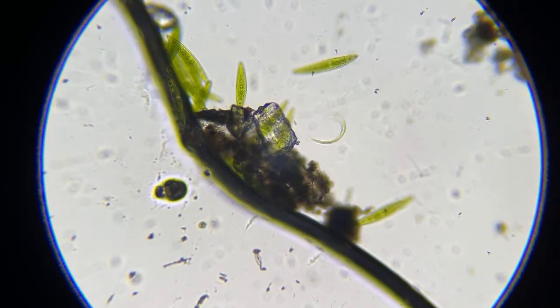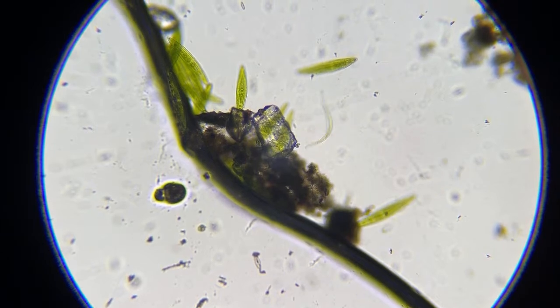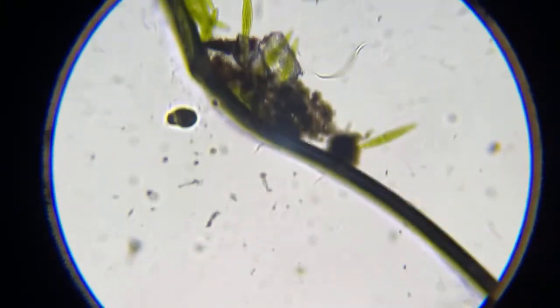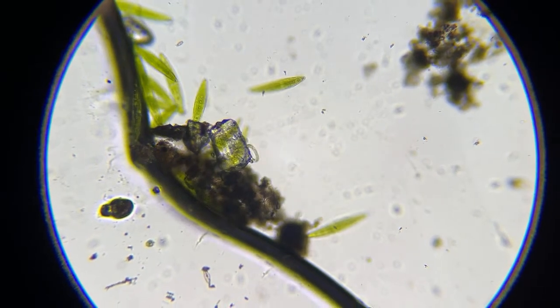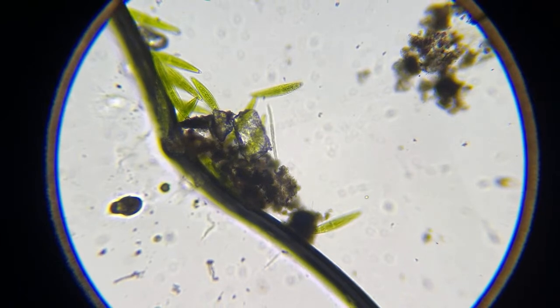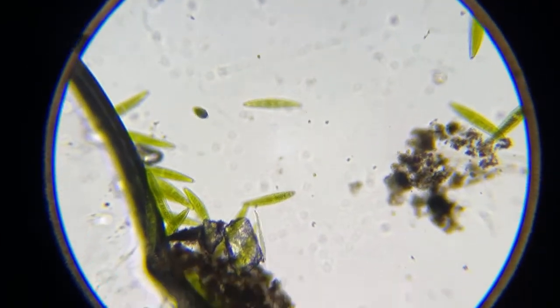And the dogs and cats and stuff poop out the larvae and adults and eggs. And then when a dog or something steps in it or lays in it, a larva will go through their feet or through their stomachs, and it gets, oh, look at that. You see the water drying up? You saw that? Saw the little bubble move? So the water is drying up a little bit.